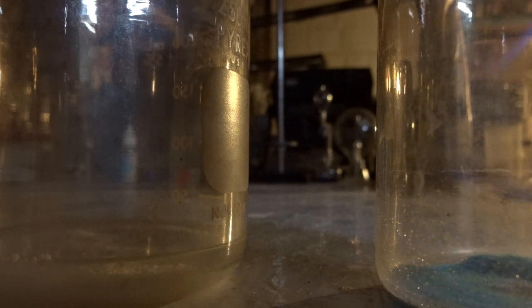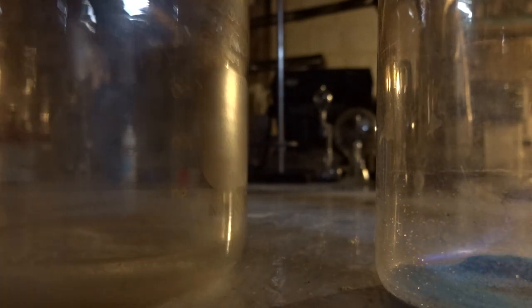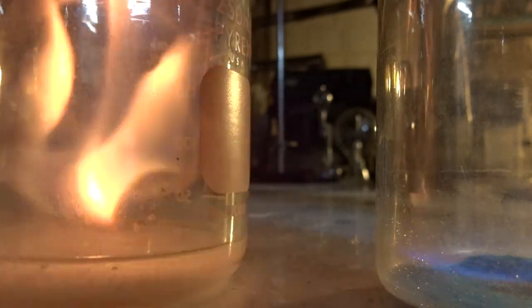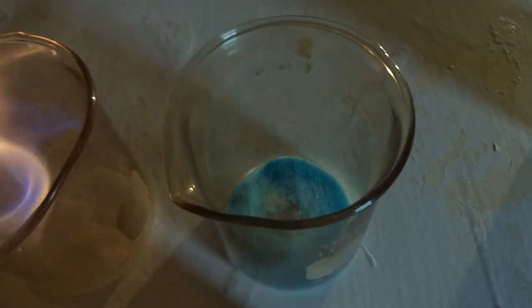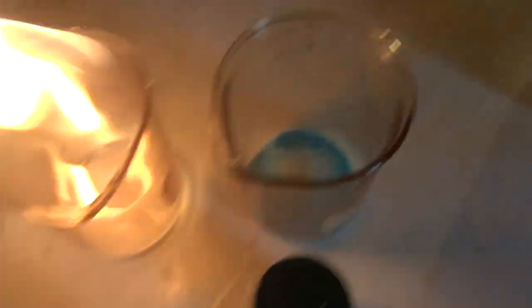I'm adding some more alcohol to the beakers that went out. Here we can see the copper beginning to flame green. The copper just went out.